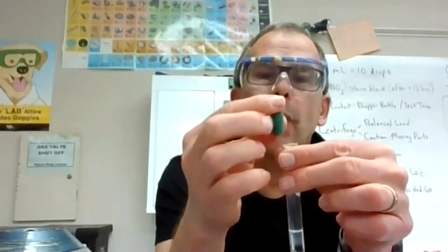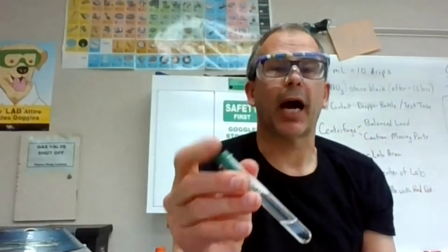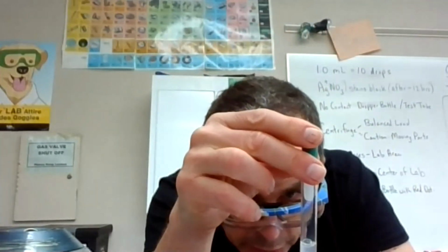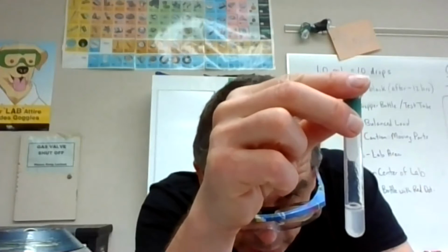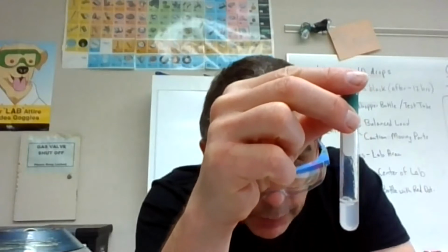This is an interesting test because I don't see much cloudiness, but I see a little haze toward the top. This is the one where you want to mix and look for the fish eggs. It's not really fish eggs, but it looks like fish eggs. I give it 2 quick shakes, and it looks almost gel-like with some bubbles, a little slimy like fish eggs might look. So this is a positive test, or a precipitate, for this particular reaction.